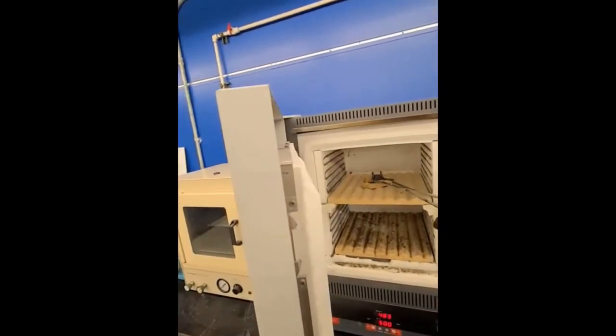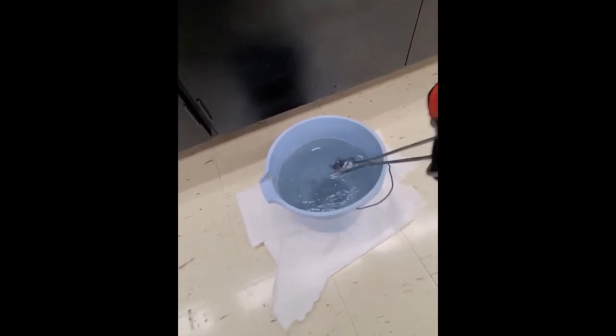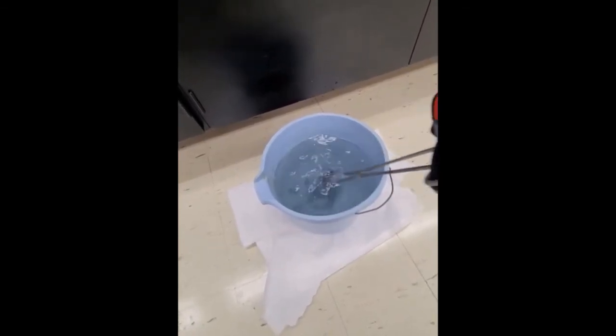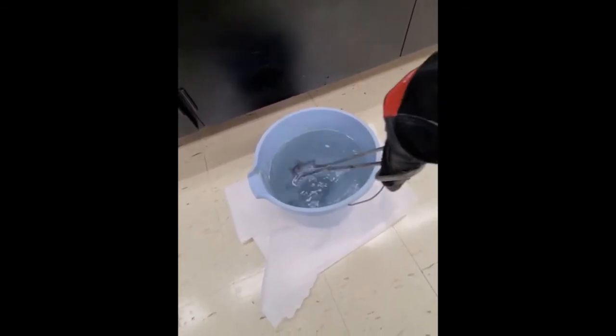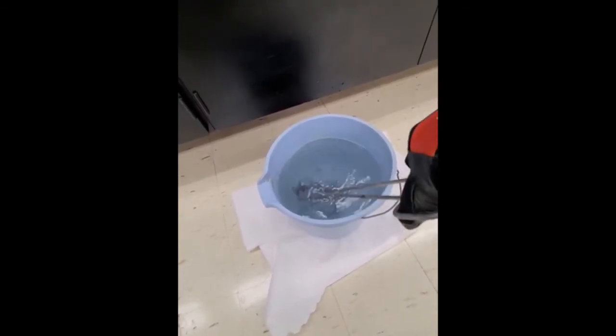It's 500 degrees C in there. I'm gonna take this out and quench it down in our salt water. You could hear that sound when I put the water in, or when I put the hot piece in. So that's just forming those vapor bubbles, okay? As you can see, I'm moving it around to help make sure that we don't keep a large Leidenfrost situation going on.